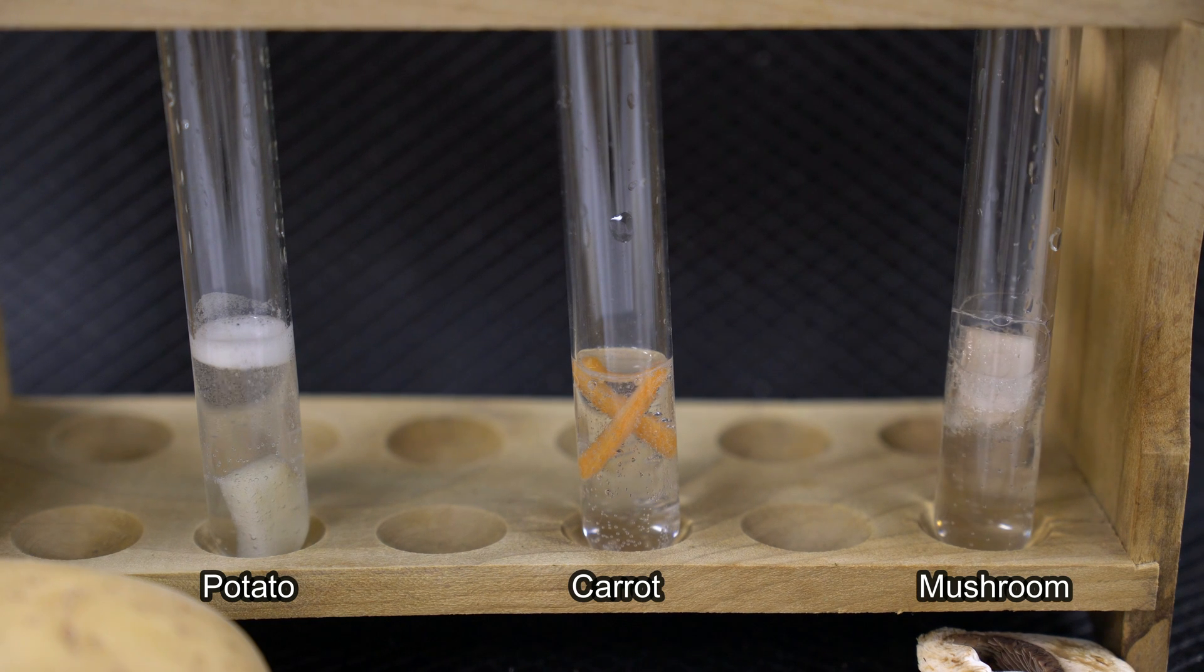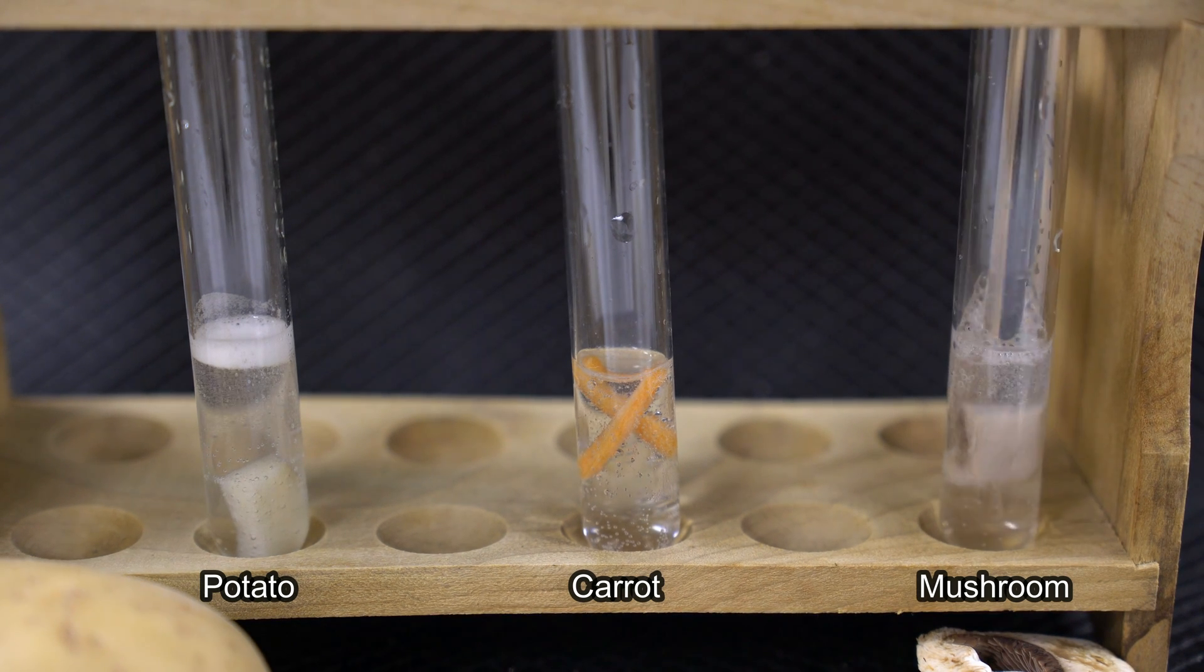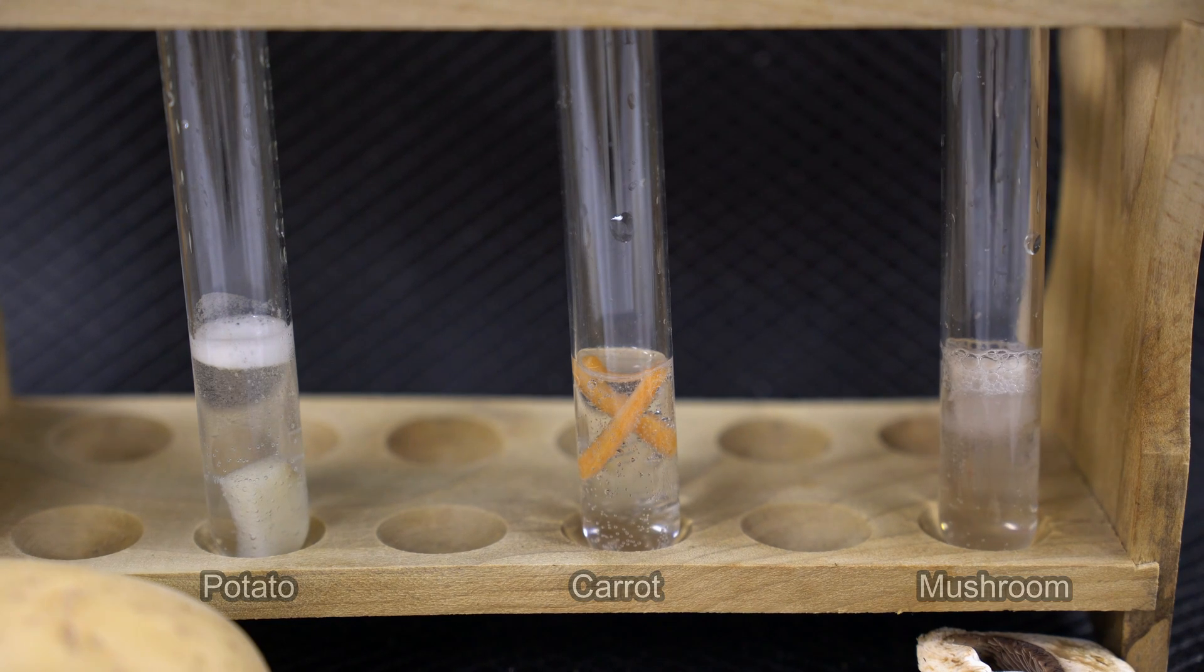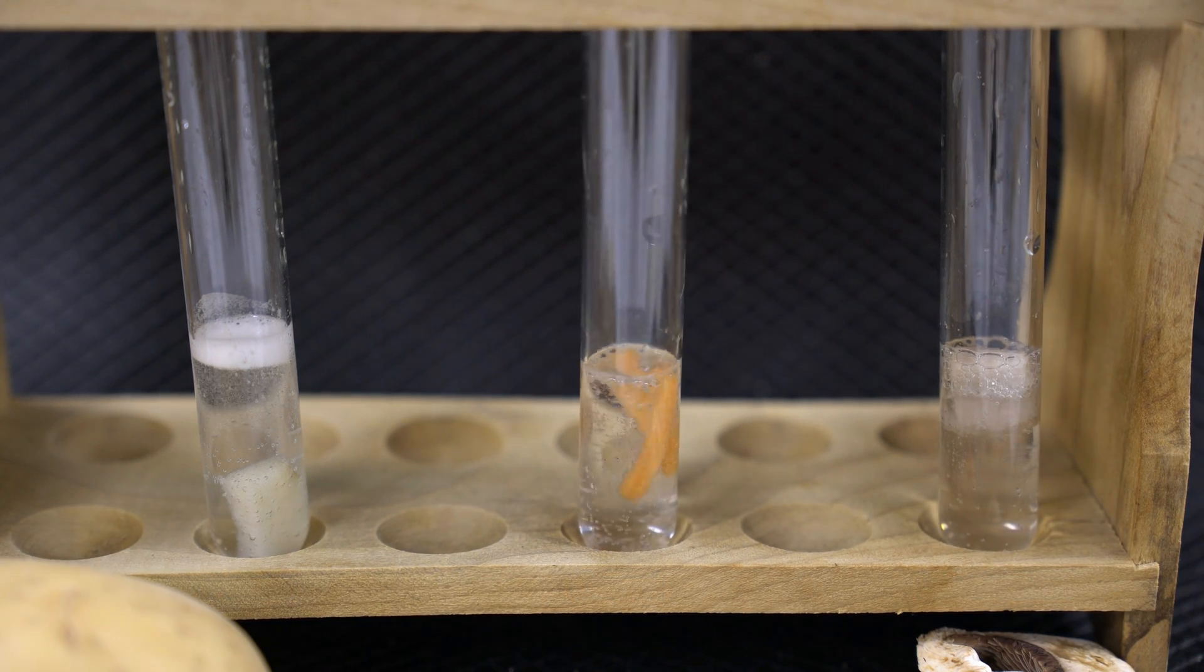So again, looking at our rate of reaction, making sure they're all coming in contact adequately. Let's see the differences that might be occurring.